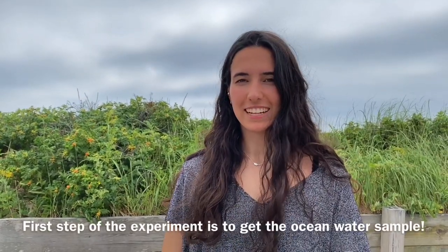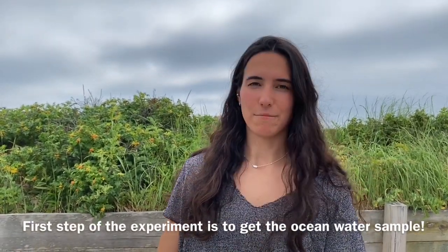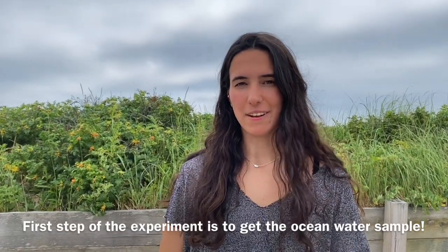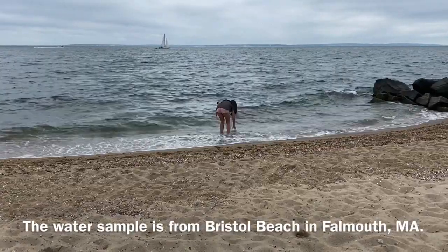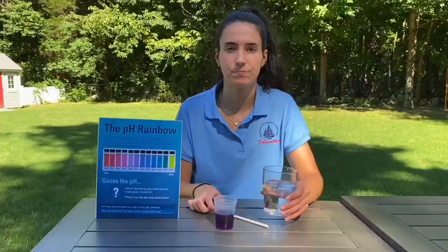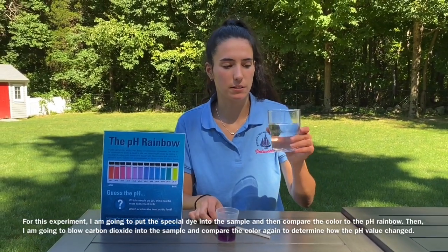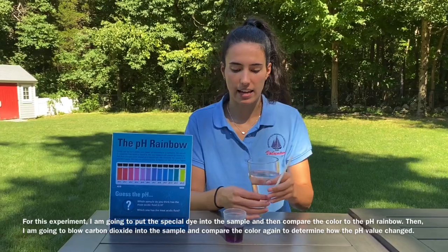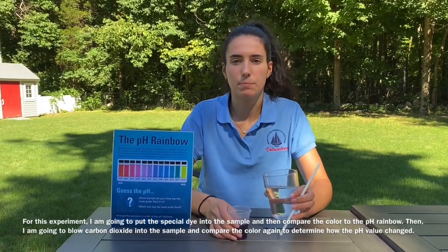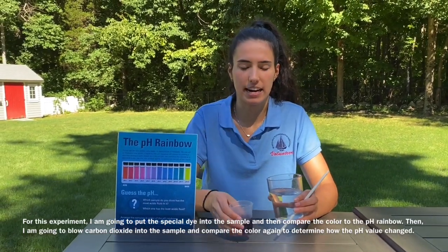First we have to collect our water, so I'm down here at Bristol Beach in Falmouth and we're going to go get our water sample. I have our Bristol Beach water sample that I collected earlier and I'm going to put some of this magic juice in there.